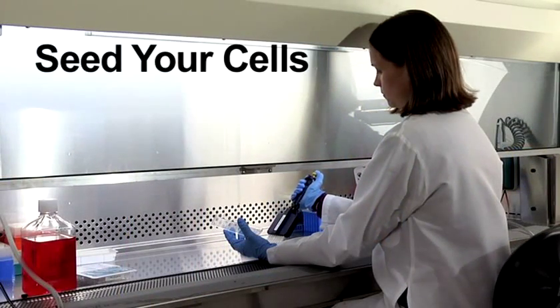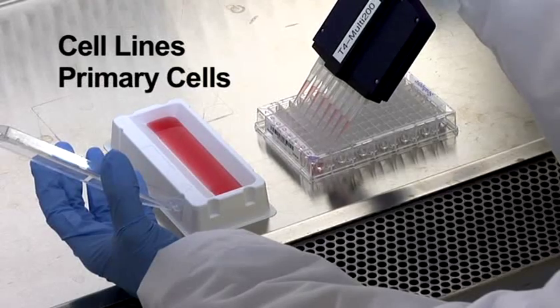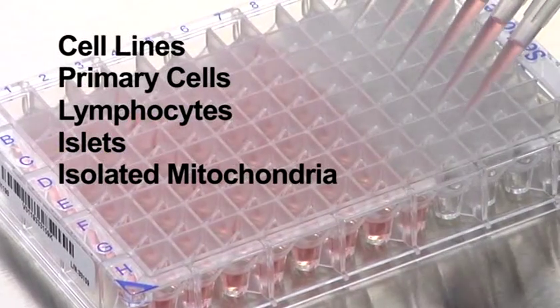First, seed your cells into the culture plate. You can use cell lines, primary cells, lymphocytes, islets, or isolated mitochondria.